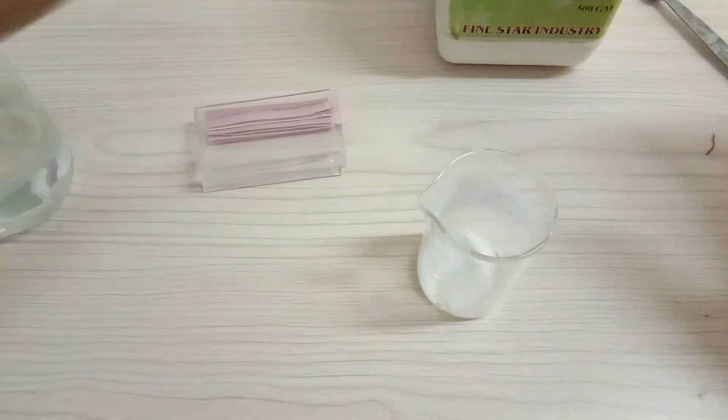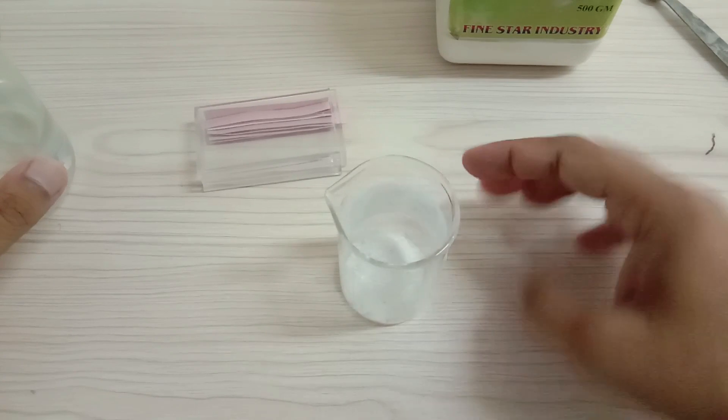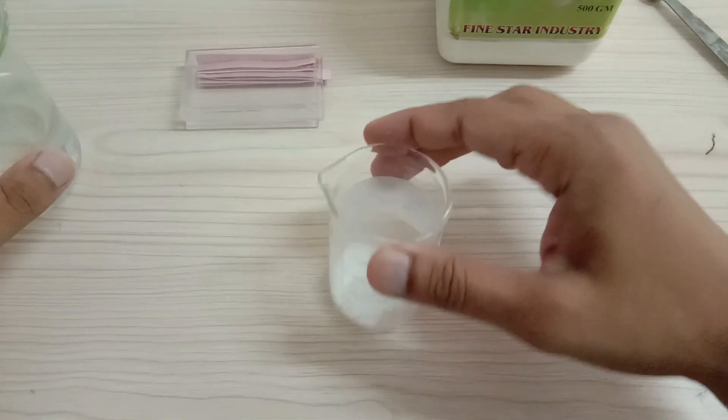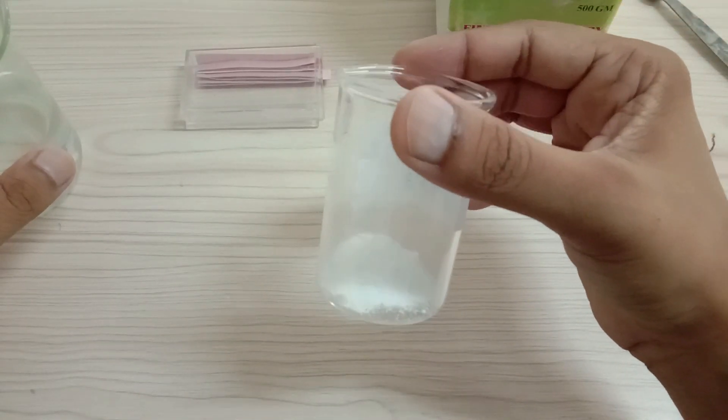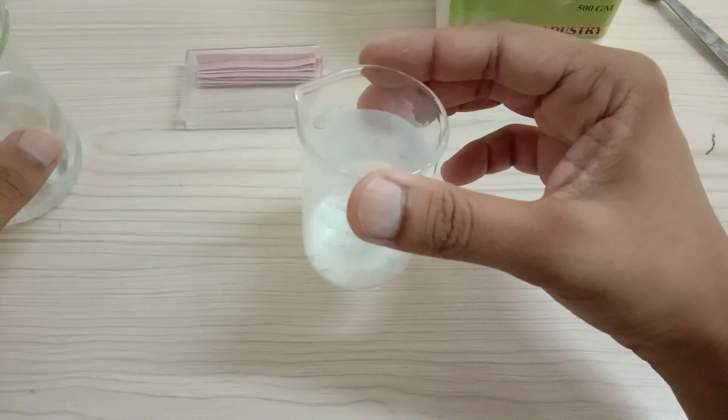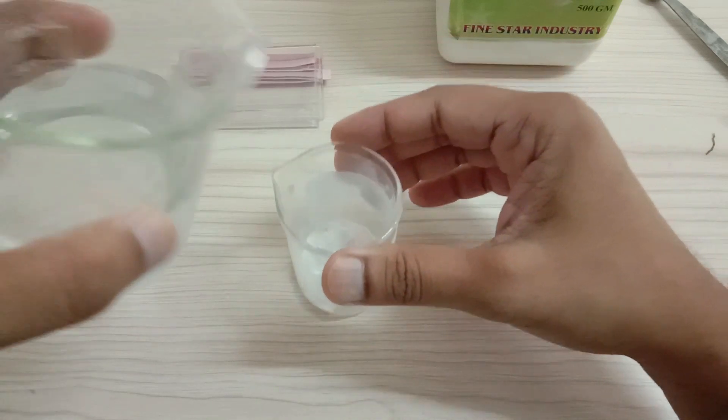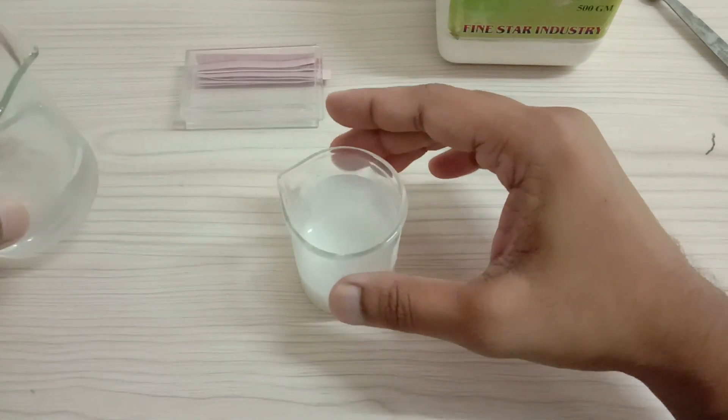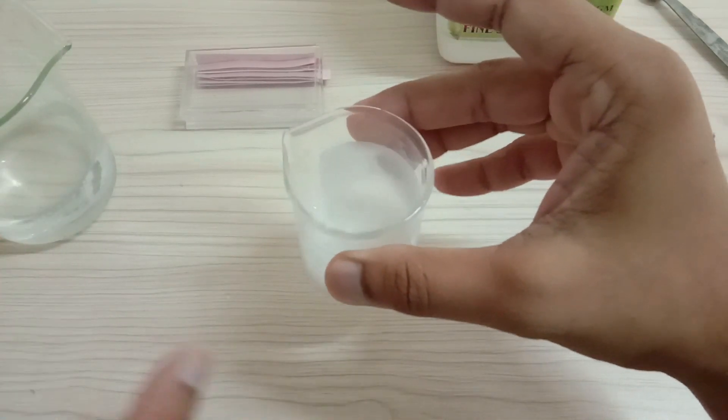So now let us add this water in the beaker, and I want to make a point that calcium oxide powder is not fully soluble in water. So we won't be seeing the complete solution formed over here. Now I am going to shake a bit.